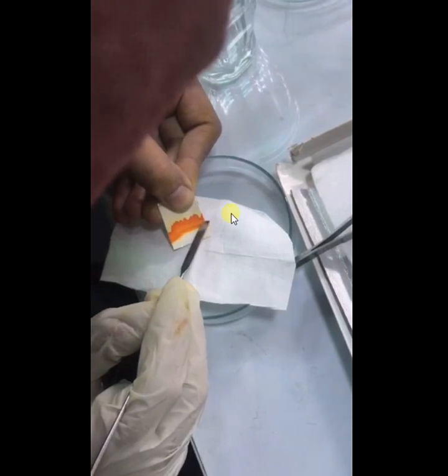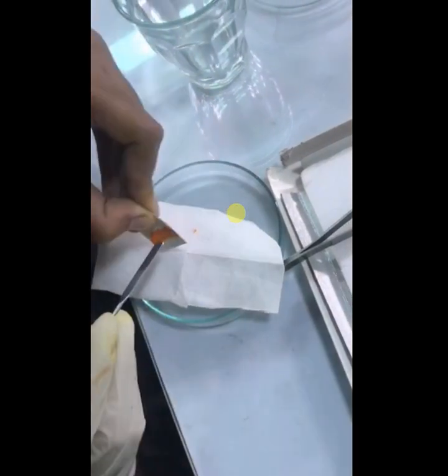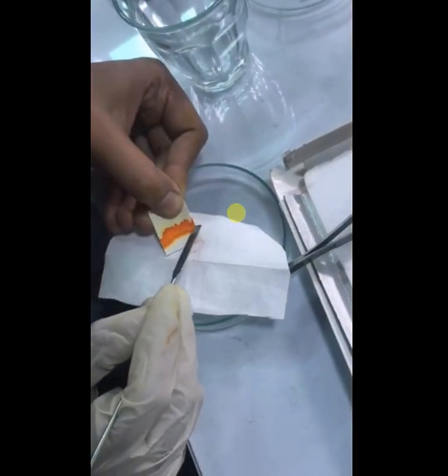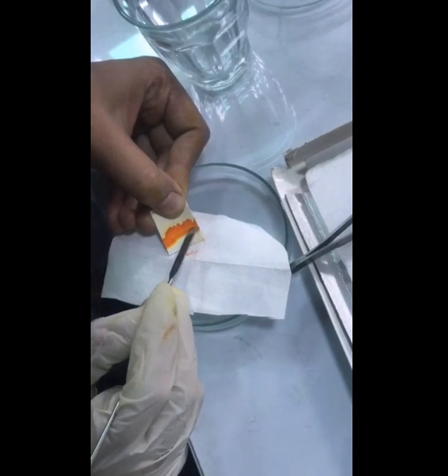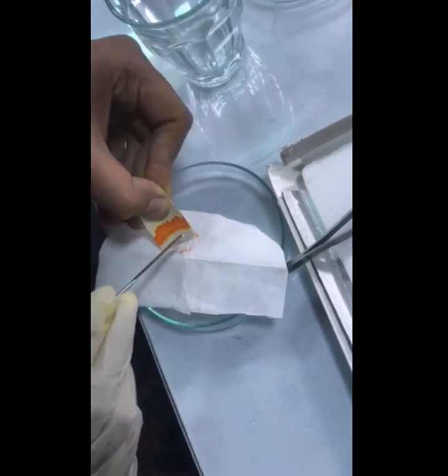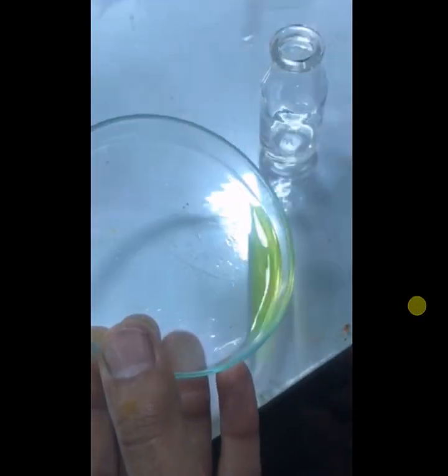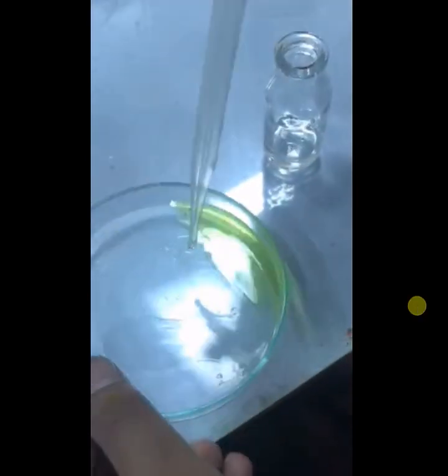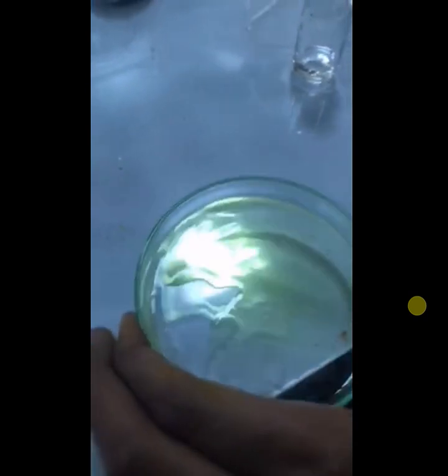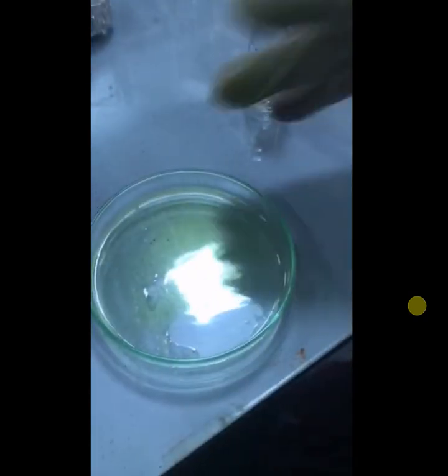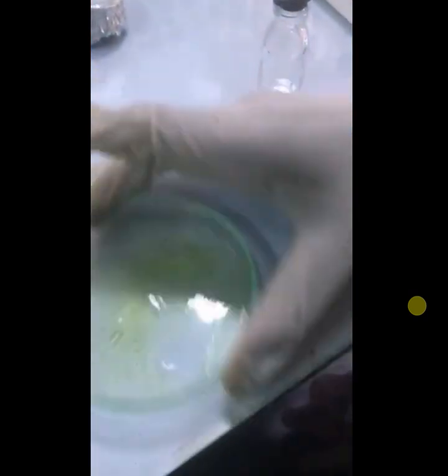I scratched this and made its solution in ethyl acetate for all the scratched compound. When it was soluble, I simply took this solution and poured it in a dropper. I used a simple glass dropper in which I already placed a little bit of cotton.